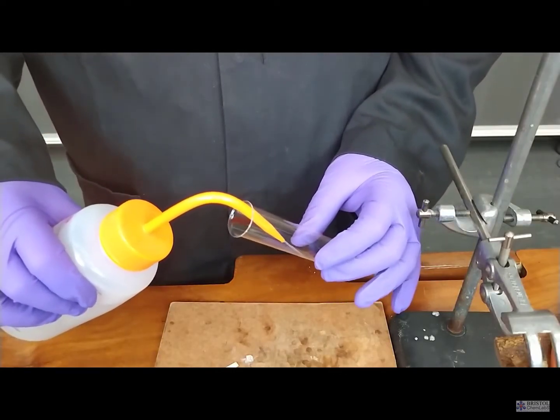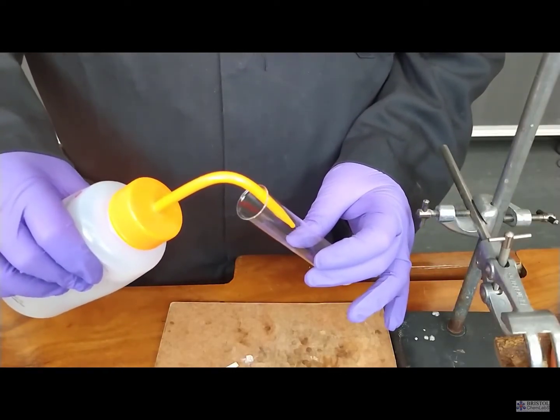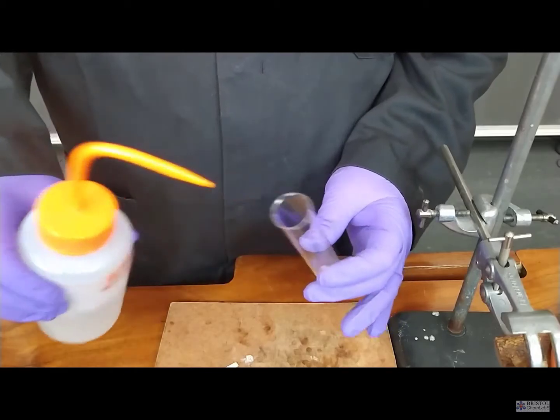The catalyst in this reaction is aluminium oxide. Now we're using aluminium oxide powder here, which you will need to slide in once the tube is clamped.